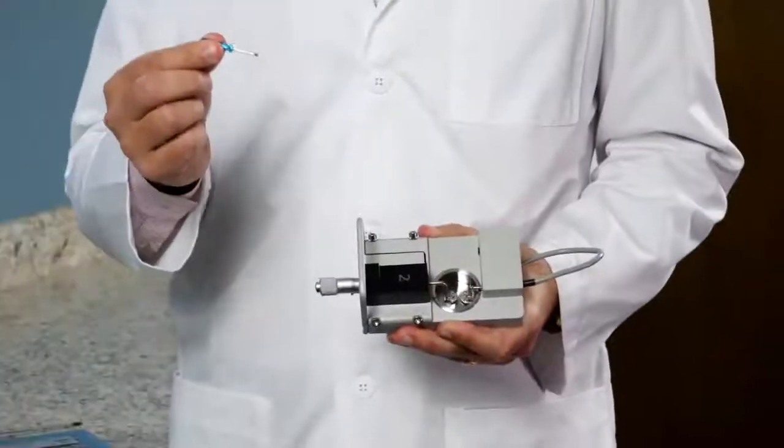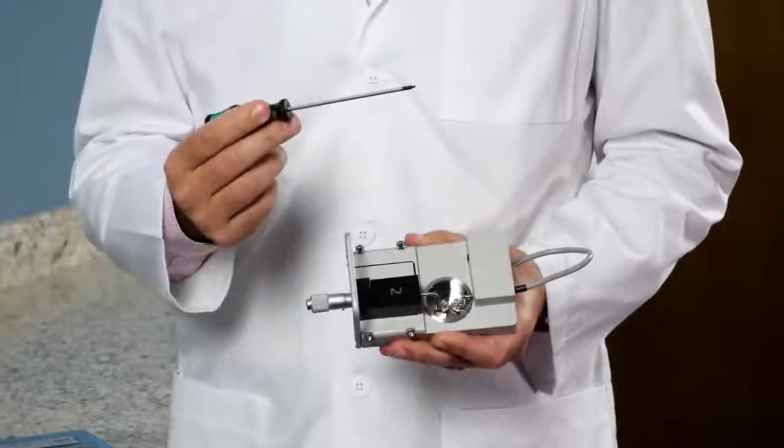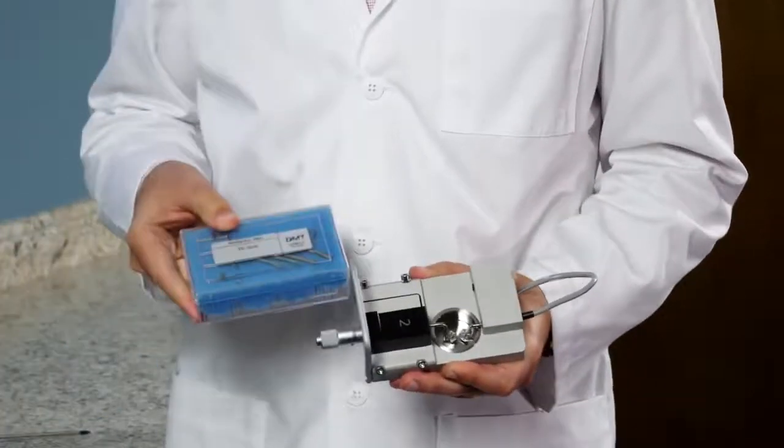You will need your screwdriver, your ball end screwdriver, as well as the mounts that came with your system.